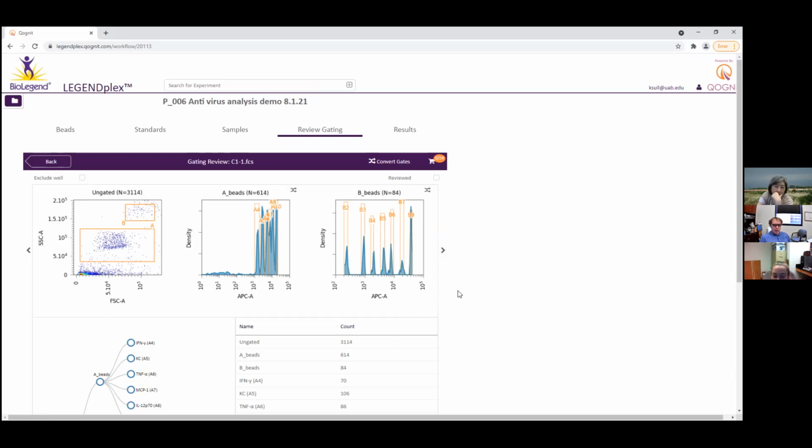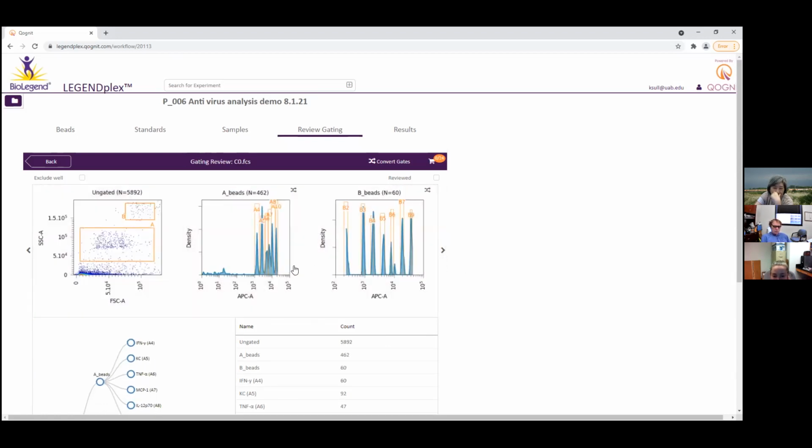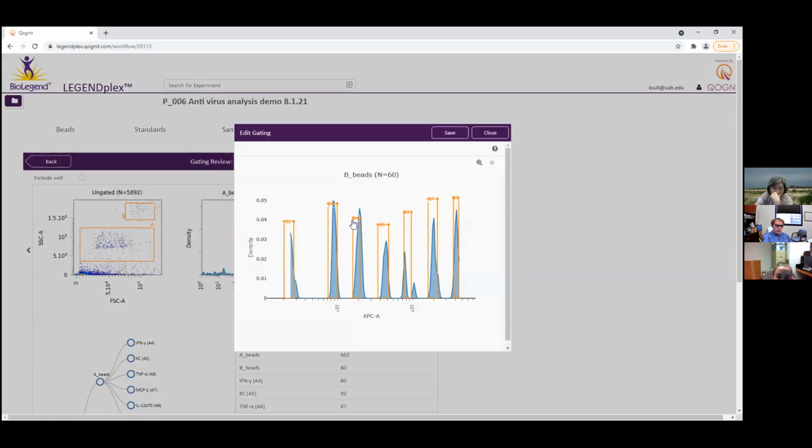So he showed me to stamp the gating at the bottom. All right, I understand. Then I can go through all of them like this, and then we adjusted all the gates from there. Can you move them around now? Can you show me a sample, like B2 up there? Can you click on that and move that little thing around?